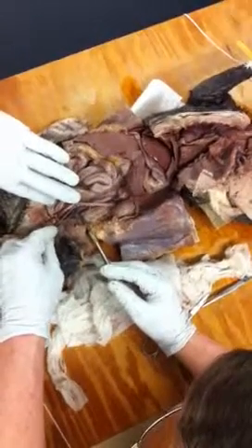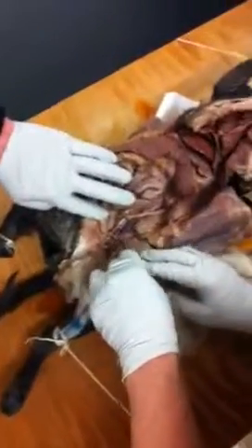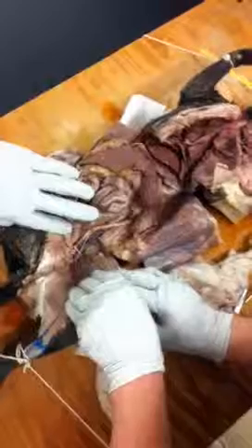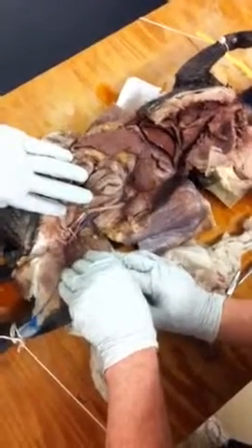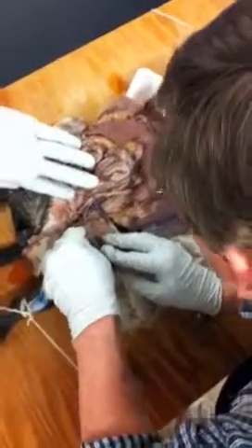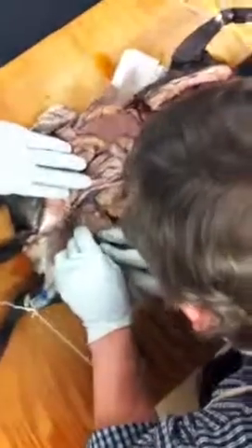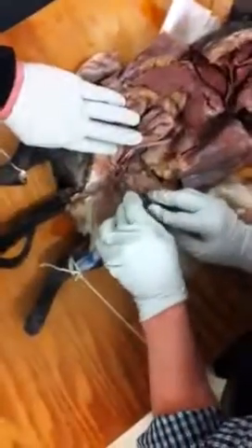So it starts out with a common iliac right at the branch point, very short common iliac, and then it goes in and parallels the external iliac artery, and it's an external iliac vein there. The internal iliacs follow the pudendal, and you can't really see them. They're not well dissected here, so we're not going to worry about it.